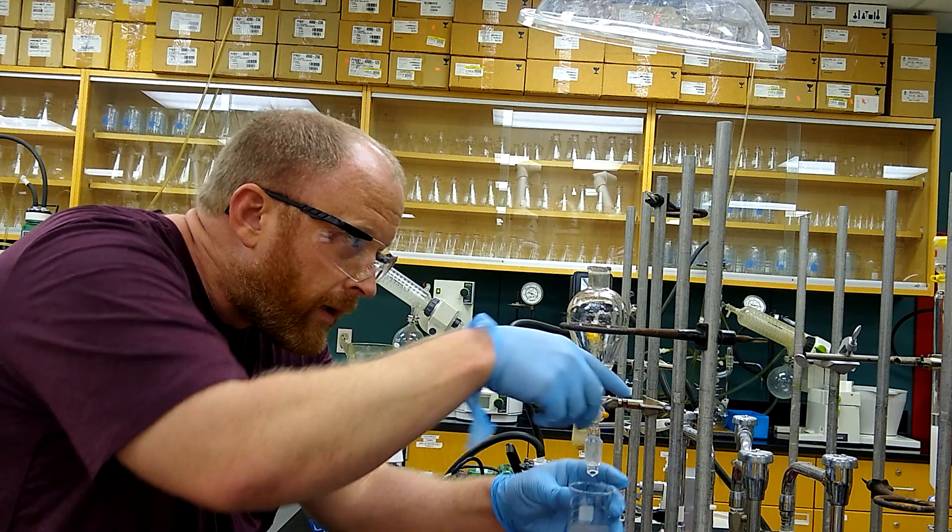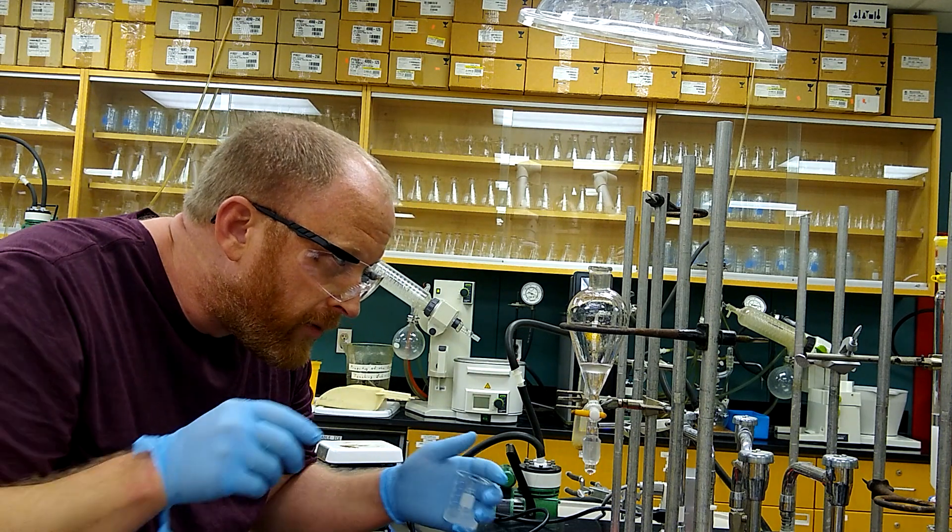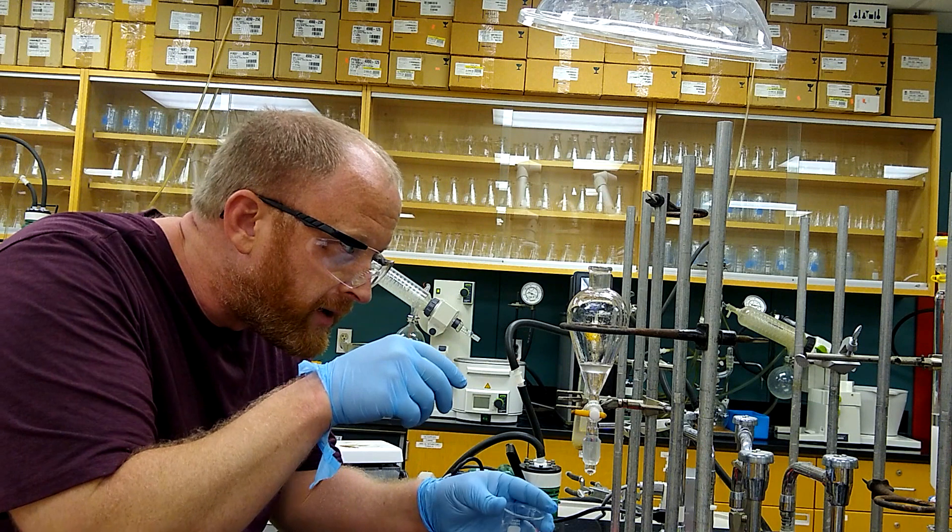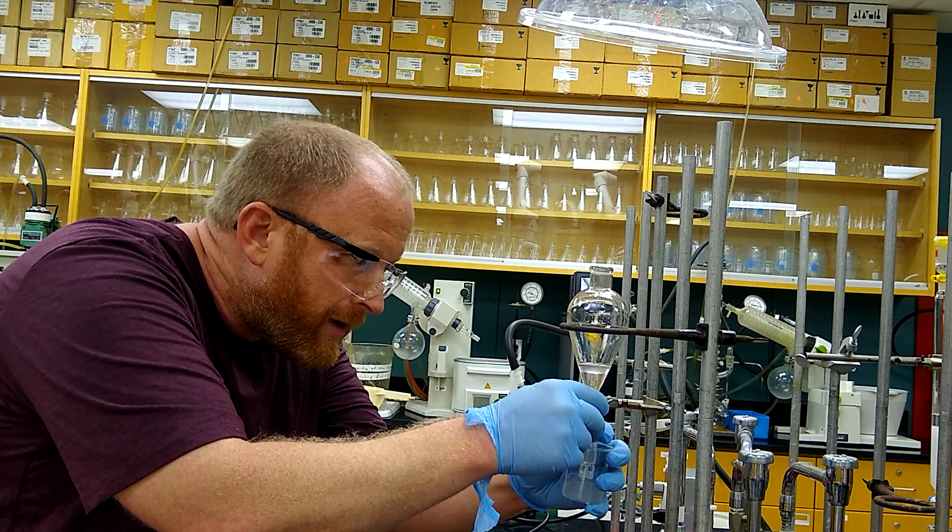Now I'm draining off that aqueous layer again, giving it a couple more seconds for the layers to separate a little better.